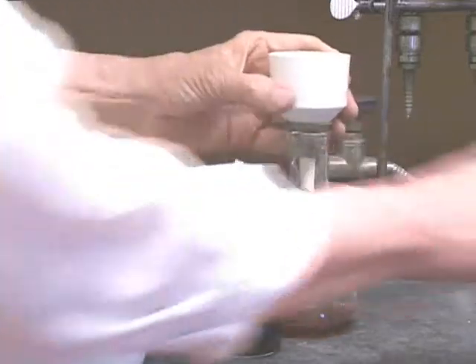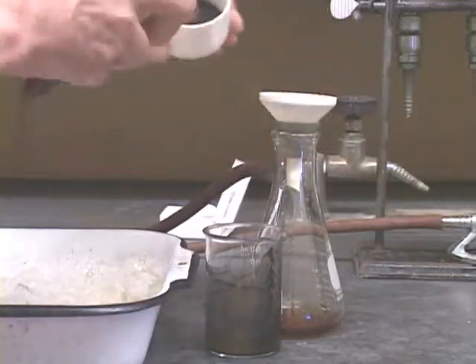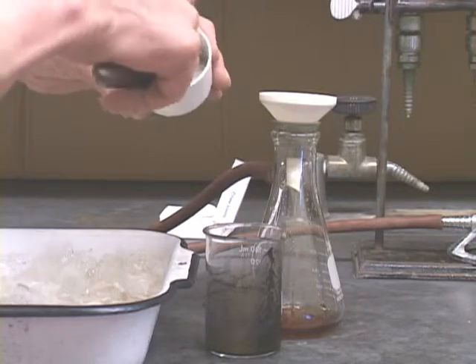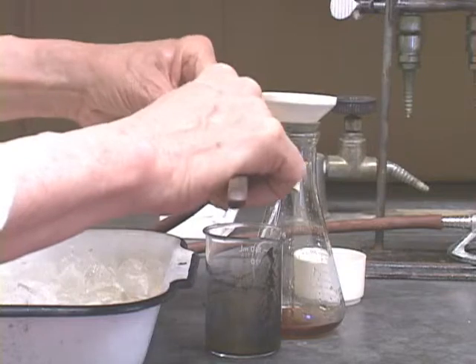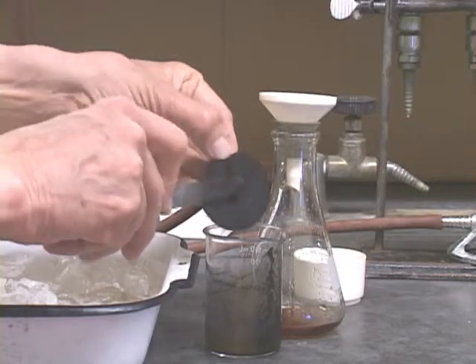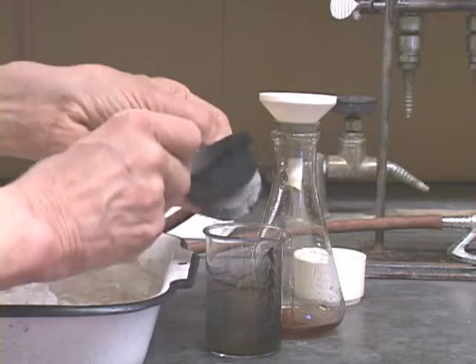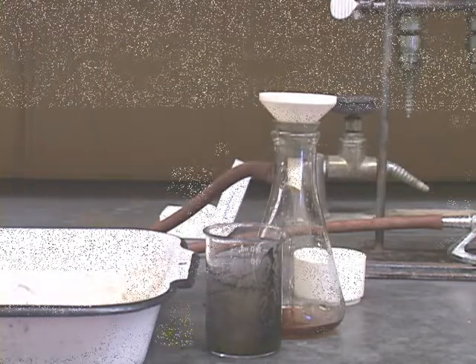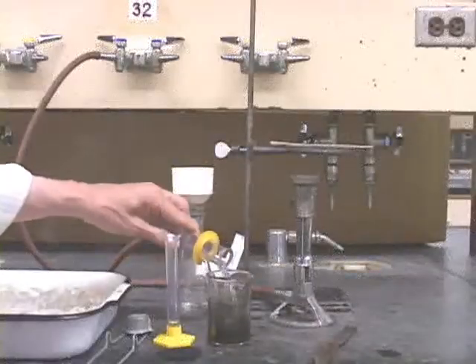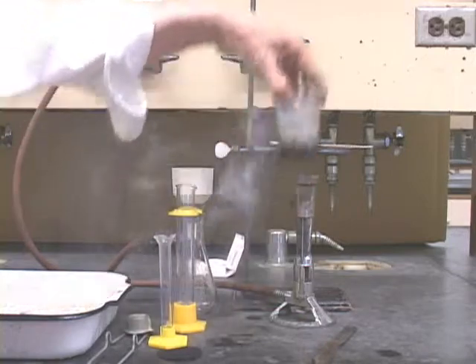To purify this material, scrape the collected material from the filter paper back into the beaker. Try to collect as much product as possible, even if you scrape off some lint from the paper. Dissolve this by adding water with some HCl and heating to boiling.